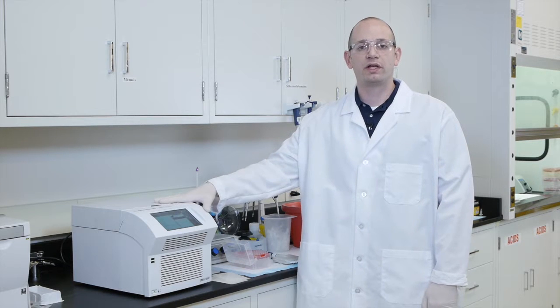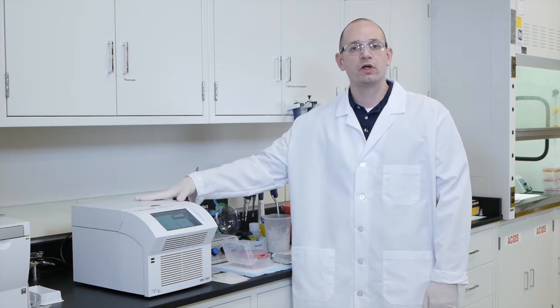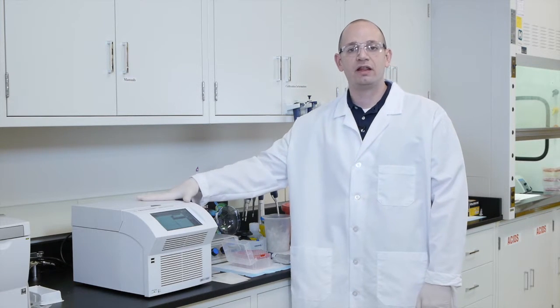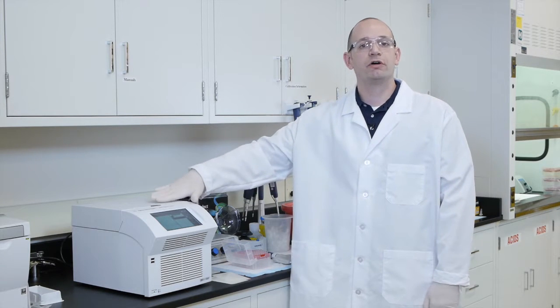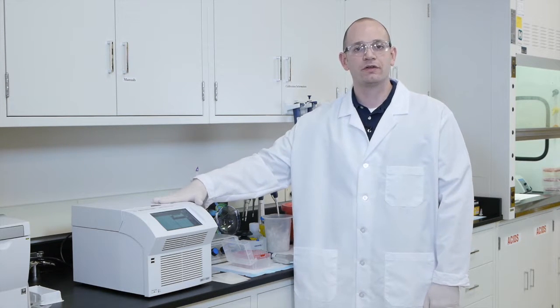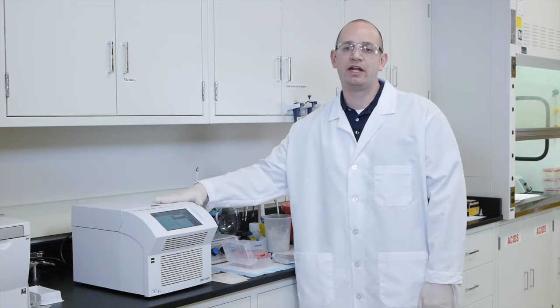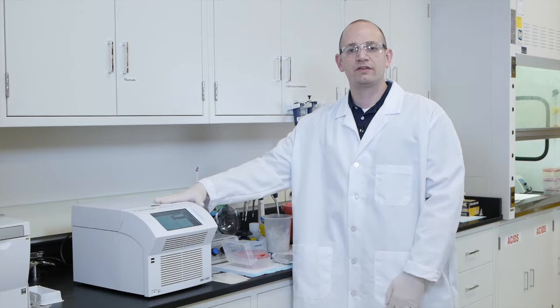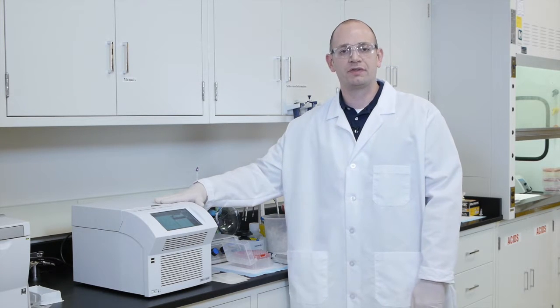So now that the capture baits are ready, we're going to perform the mixing step of the hybridization protocol where we combine the hybridization buffer with the capture baits, and then finally the library that we prepared with the hybridization buffer and capture baits pre-mixed together. This is essentially a two-step pipetting process and needs to be done efficiently to ensure that we're not suffering any kind of evaporation during this step of the protocol.